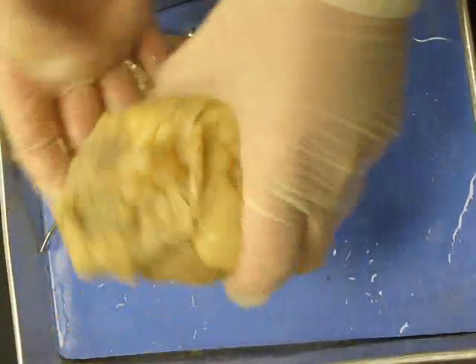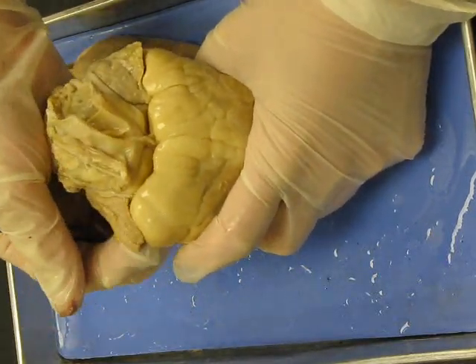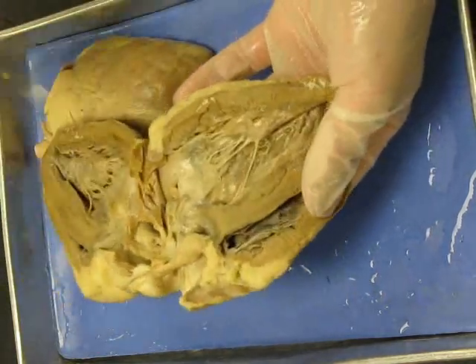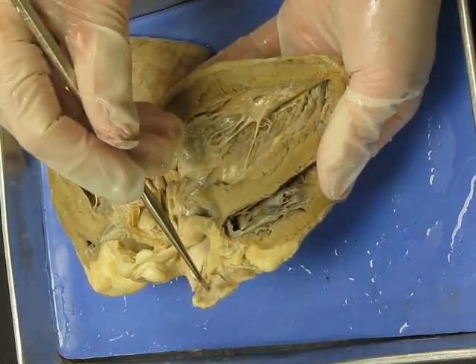Okay, and then we also had some auricles. This is the heart from the outside. So your atria would be on top, and you've got auricles. How do you tell if they're right and left? You look at them this way, left auricle. There's your little flappy guy. Right auricle.